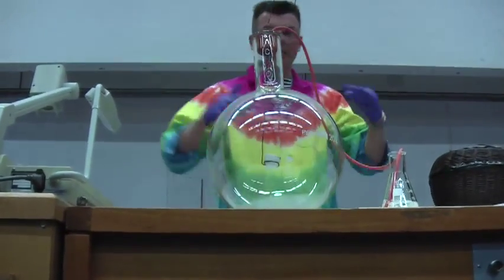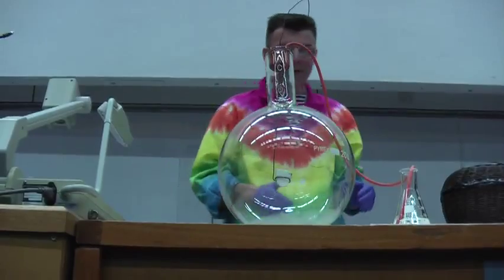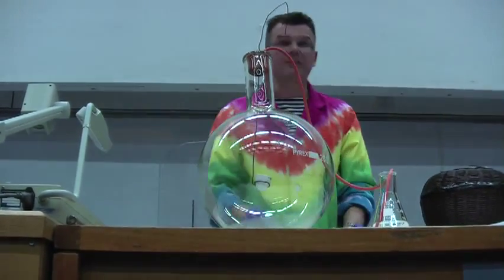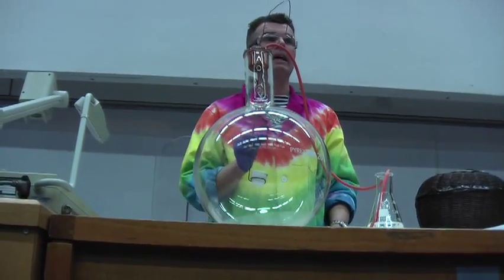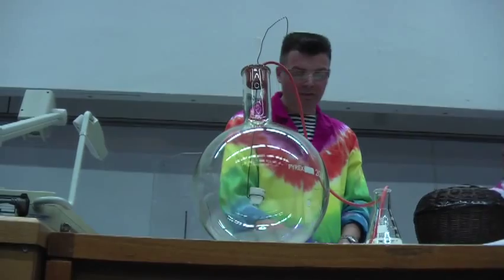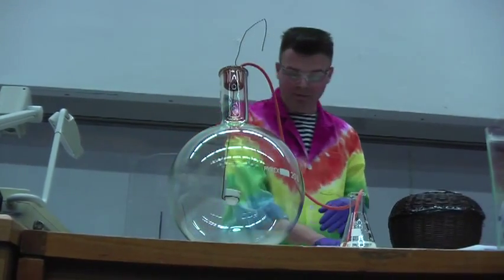In a little while we'll start the experiment, and then we'll have the lights out please, because it's going to make a nice glow and you'll see lots of tendrils of phosphorus pentoxide. Now, the reason I'm handling this so gingerly is because phosphorus spontaneously combusts in air. So when I pick it up I'm on a little timer, because if I don't do it fast enough it'll catch fire when I'm holding it. Very funny for you, slightly less funny for me.